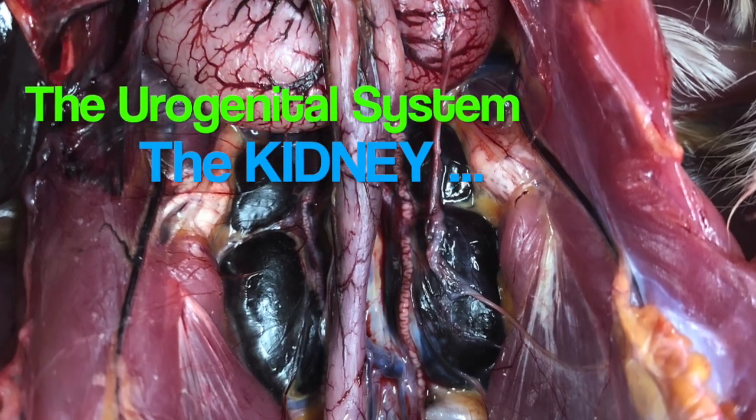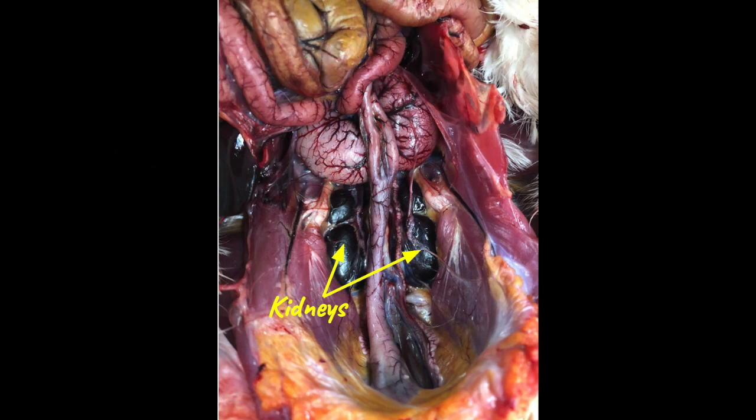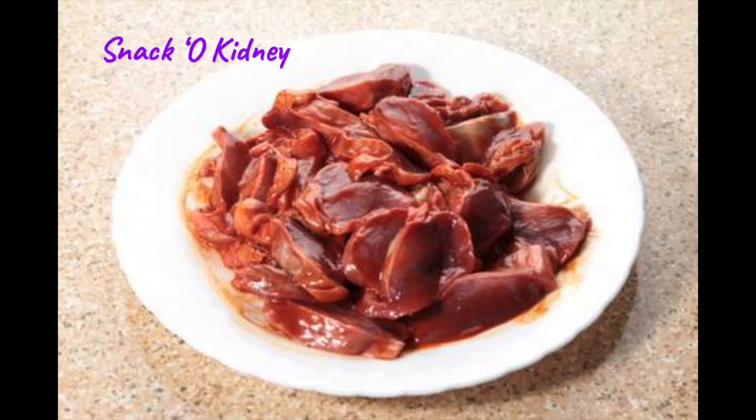The kidney removes wastes of metabolism and maintains the osmotic fluid balance of the body. Most avian species do not have a bladder, but they do have a kidney — that tastes pretty good.